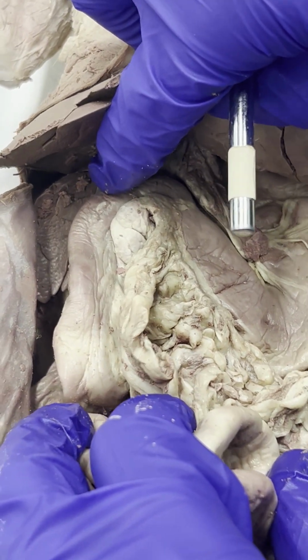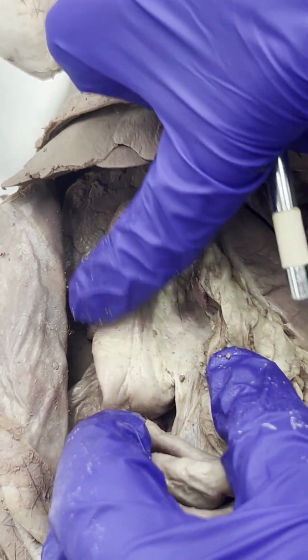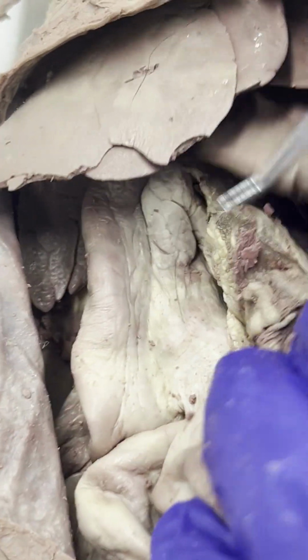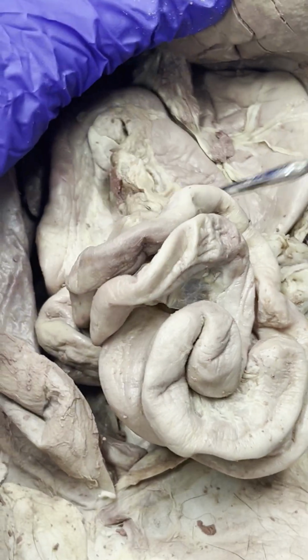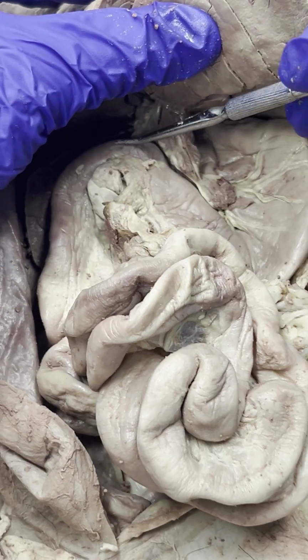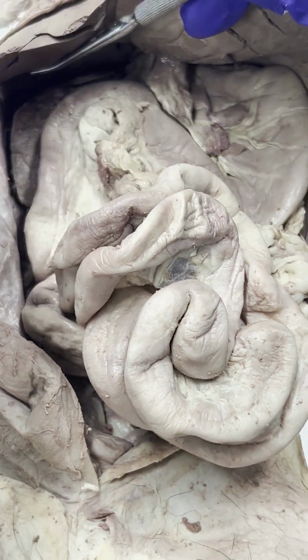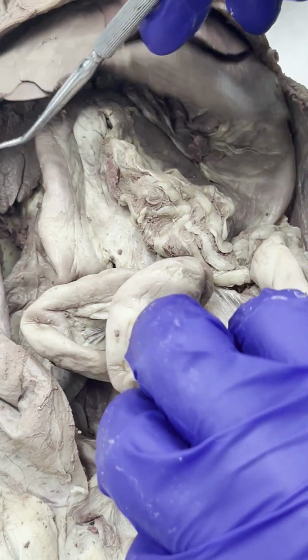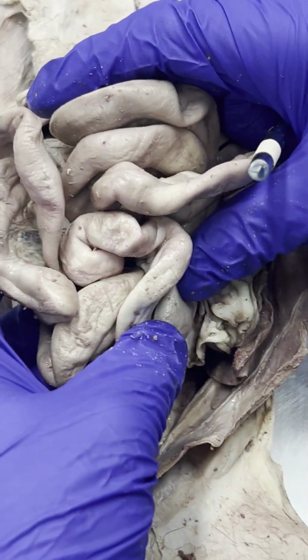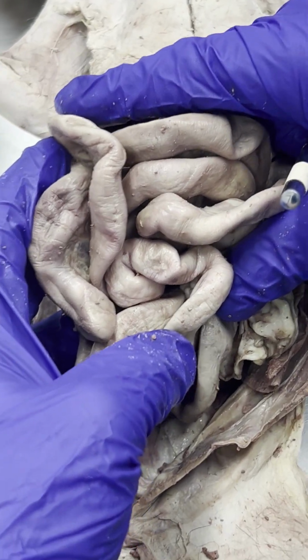The first part, and you might recall this from the frog digestive system, is the duodenum. So right here, we actually can see the duodenum. It's hard to see. Stomach, then after this pyloric sphincter, we're going to get into the small intestine. The first part is the duodenum right here, and then the rest of the small intestine is all of this. The other 2 parts after the duodenum are the jejunum and ileum, in that order.